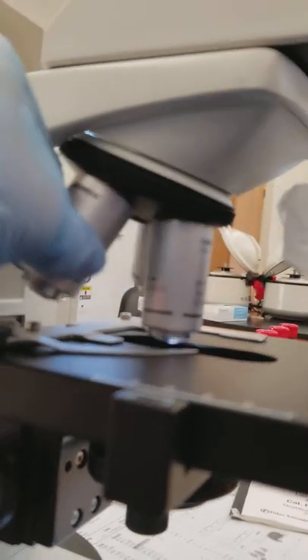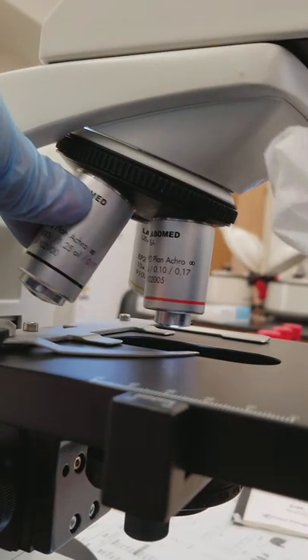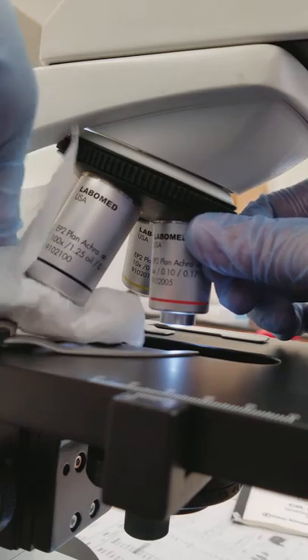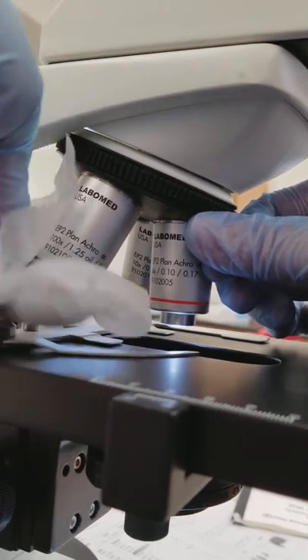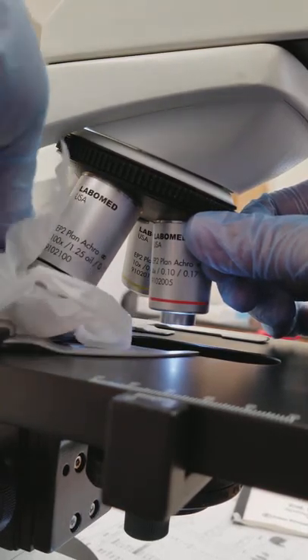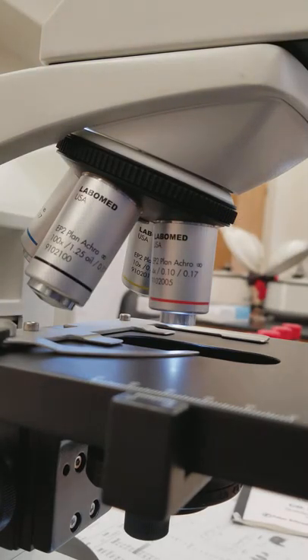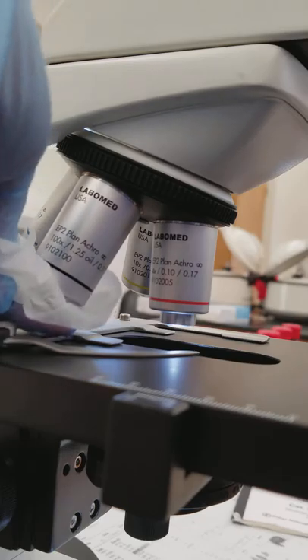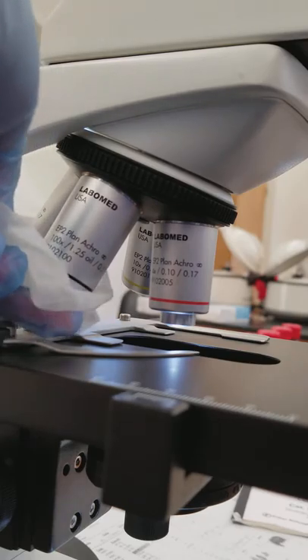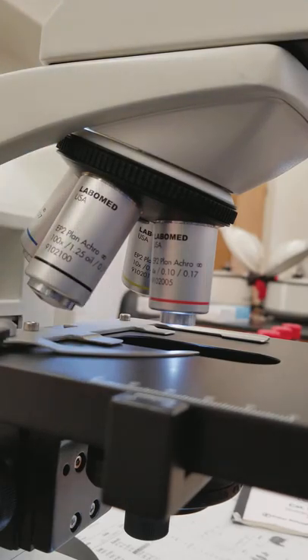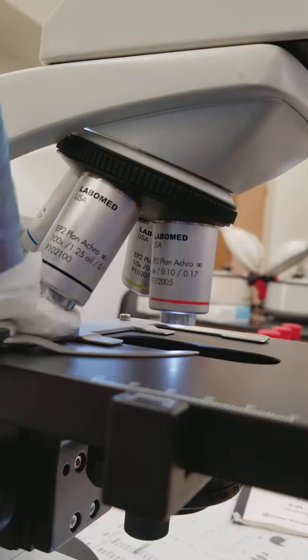I've moved my 100 oil objective over and I'm spreading this solution onto the objective lens.